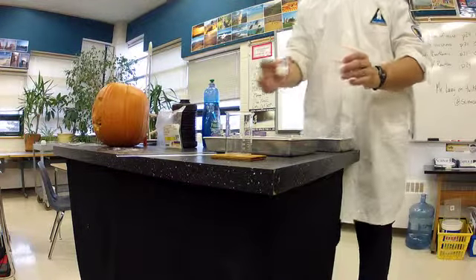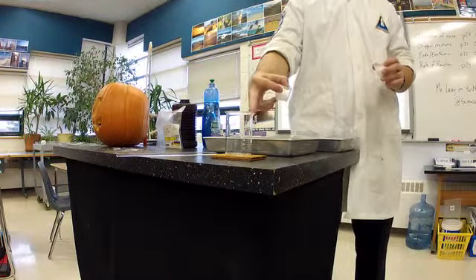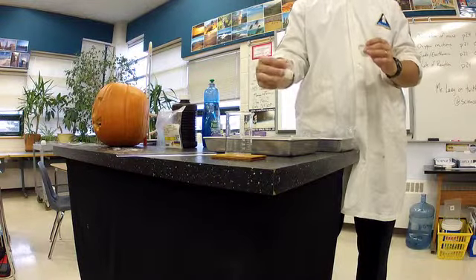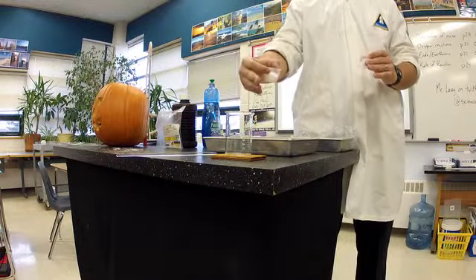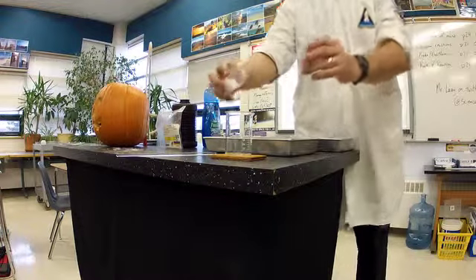So I'm going to mix the two together. It's on a piece of wet wood. So think, try to predict in your own mind what might happen when this reacts if it's endothermic.